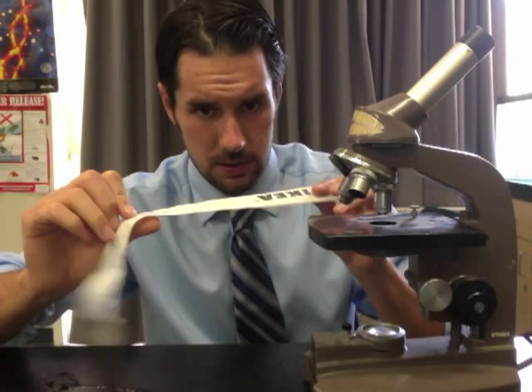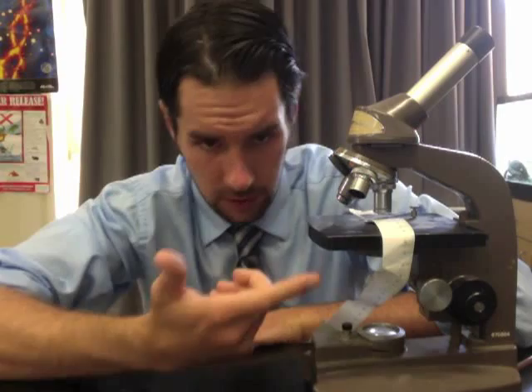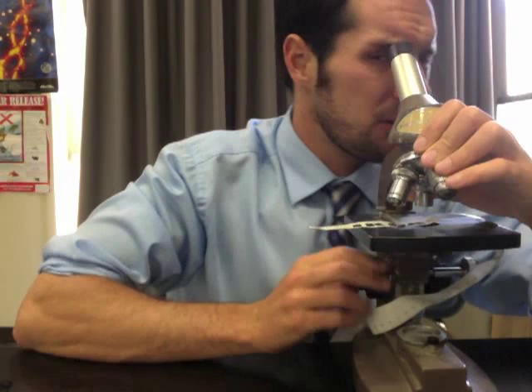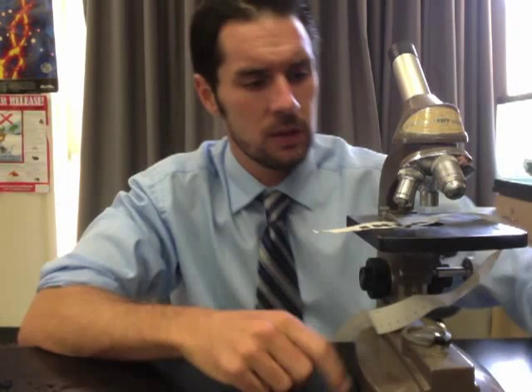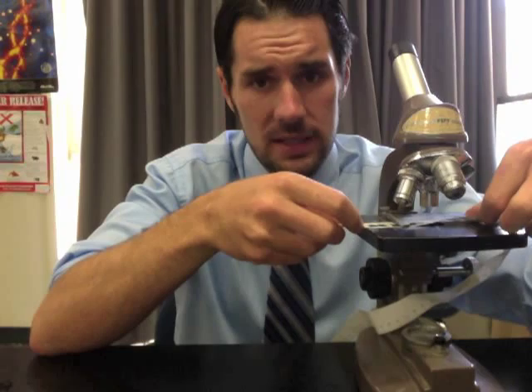When I want to observe something, I take it and place it on the tray. There are little clips to hold what might be a slide in place — you'll see that Monday. I turn on the light and it shines through. I examine through the eyepiece on low power first, then adjust with the largest knob — the coarse focus knob — until I can see the object come into view. Once I have it in view, I adjust the fine focus to see my organism. I then increase the power and repeat.